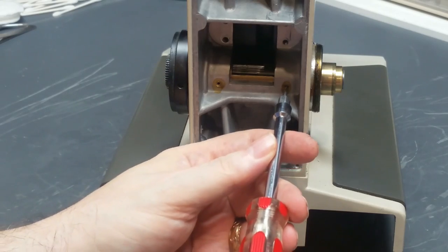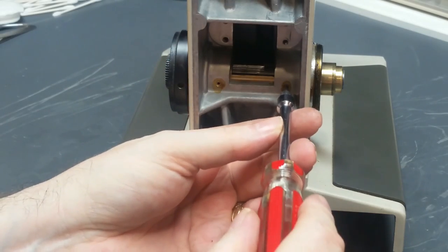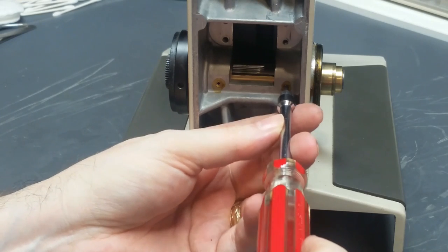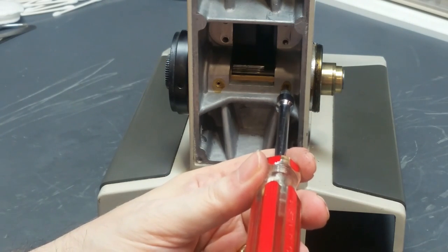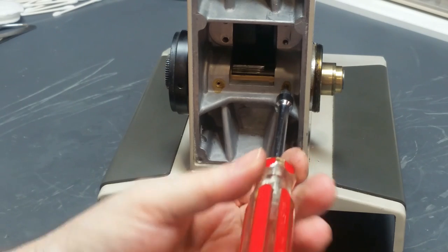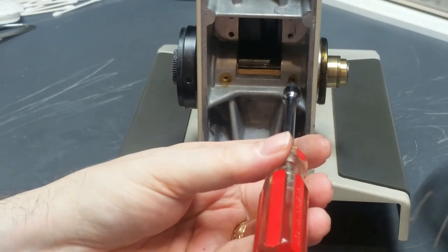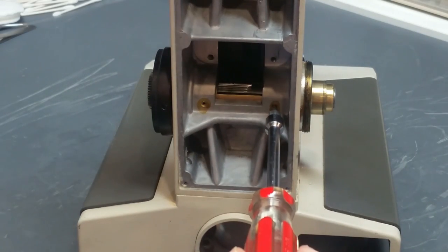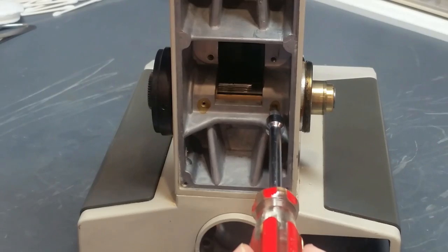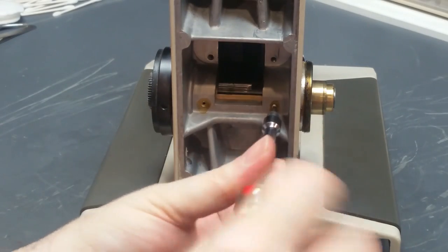Okay, now what I do is I take my 1.5 millimeter hex tool, and it's almost impossible to get these into the heads just by feel sometimes. If you can feel where it goes in a little bit, then what I do is I tap it, and if it doesn't go in, I turn it a little more and tap it lightly until it does seat. I don't want to try to adjust these if that tool is not fully seated in the head, otherwise I'm going to strip those off and that's going to ruin my whole day. So that one's coming out without too much problem.